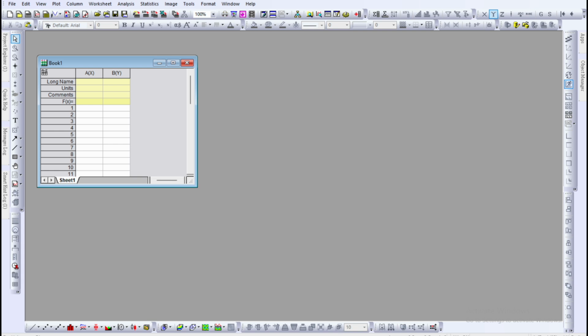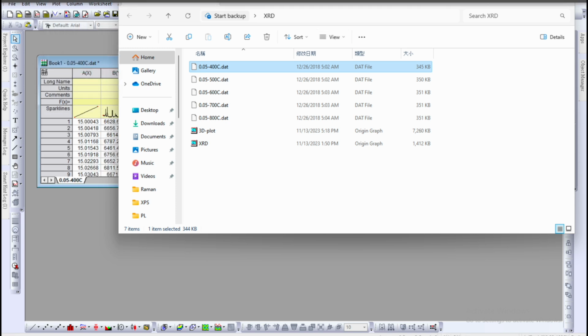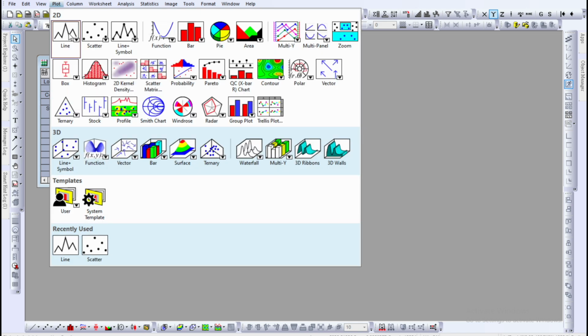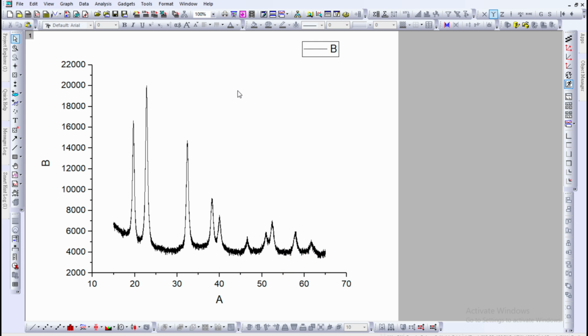In the software, go to the data folder, select your data file, drag it to the Origin software, minimize the window, select the column, then use a line plot. Either you can go to the left bottom corner or even at the top, click on the plot and select the line option, click on the line, maximize the window.